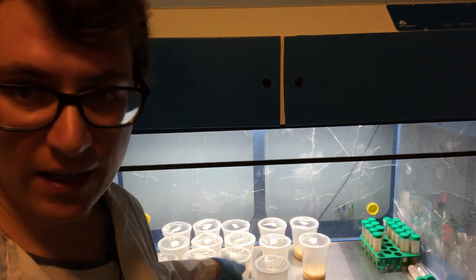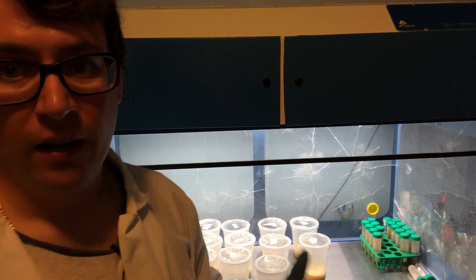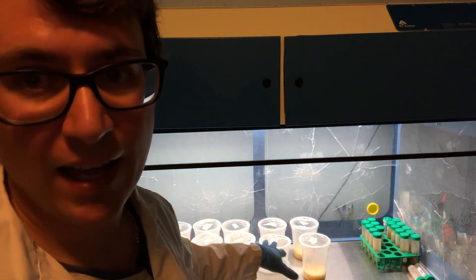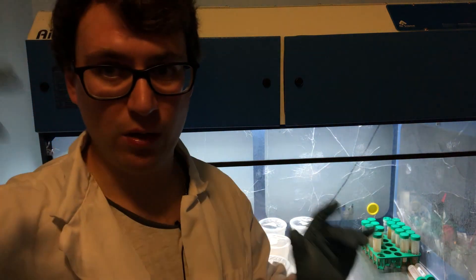I'm going to put these in my incubator at 72 degrees and hopefully in the next five or six days these will be colonized and I can move on to fruiting.